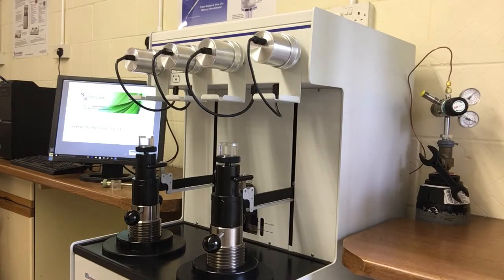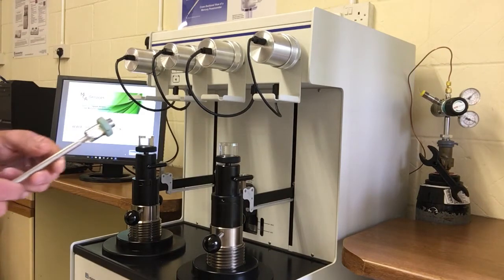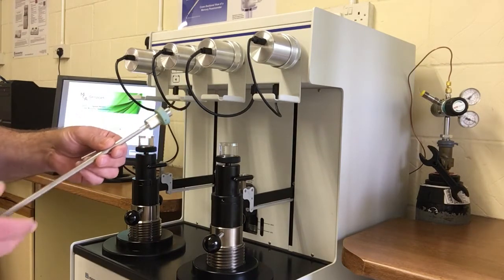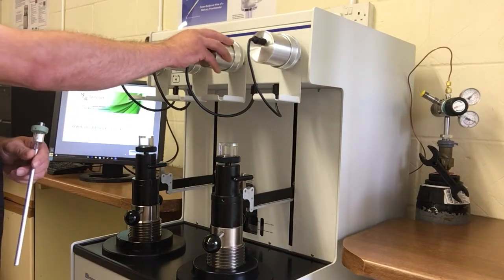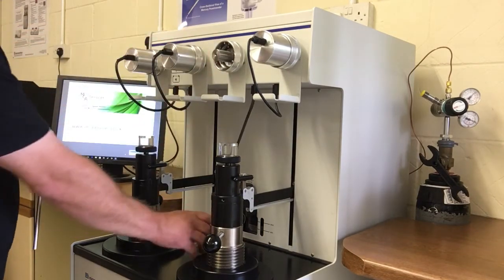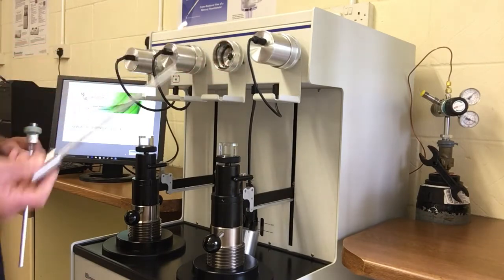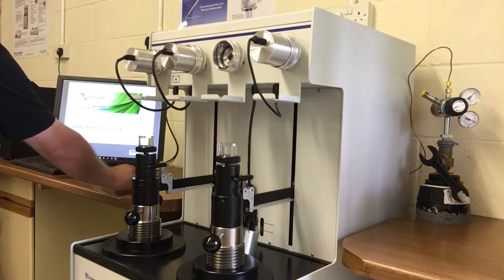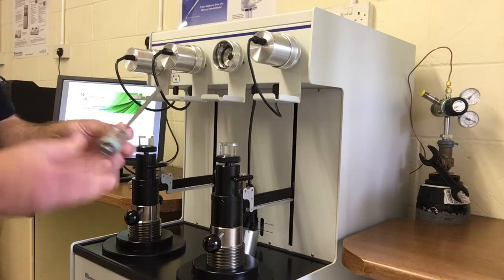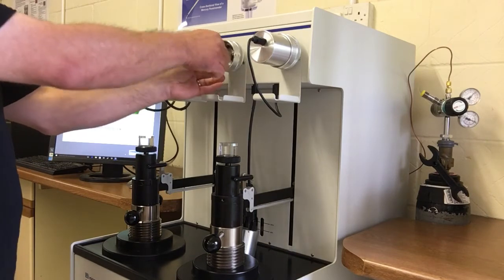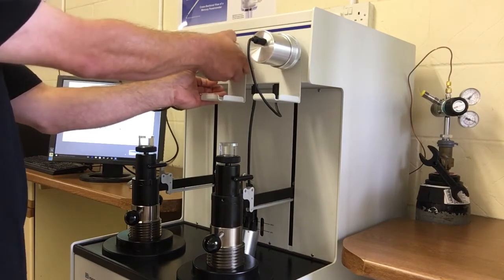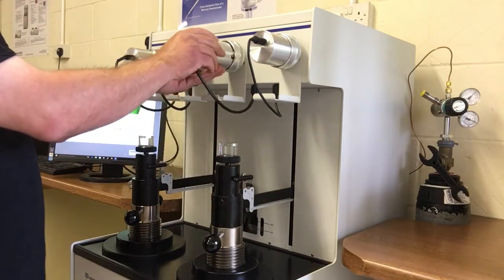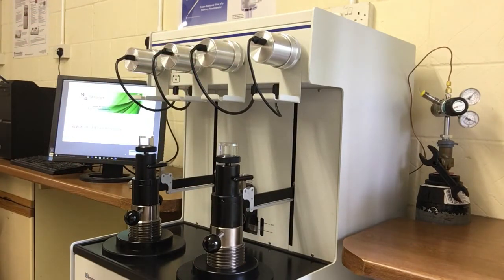So we're ready to load the sample now and this is our penetrometer that we loaded up in the last video. And it's now ready for low pressure analysis. Now we'll start with this pressure port here. At the moment it has a blanking plug in it. So we take the blanking plug out and we replace it with the penetrometer. There's a spacing collar that goes over it first and that sits in there horizontally and the cap goes back on. We're now ready to undertake the low pressure analysis.